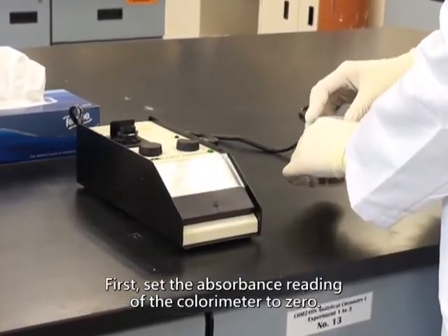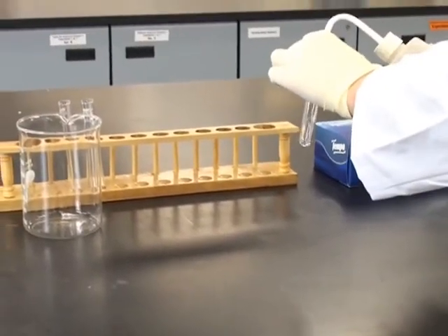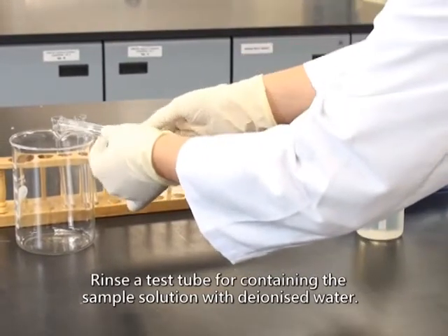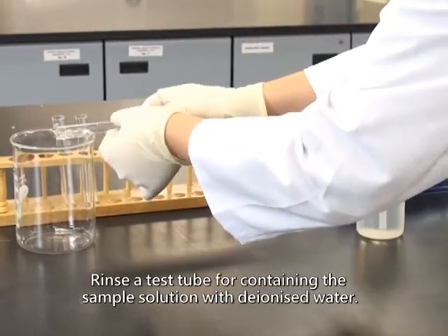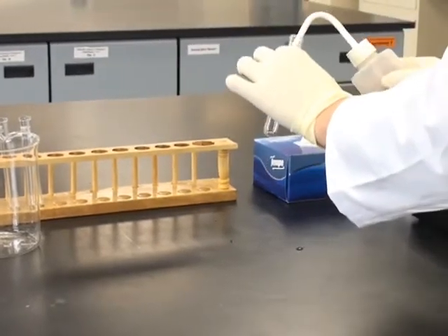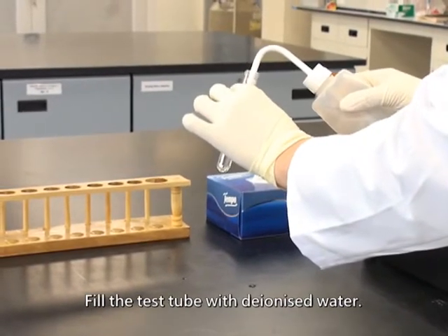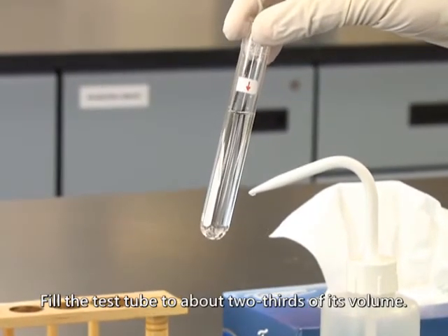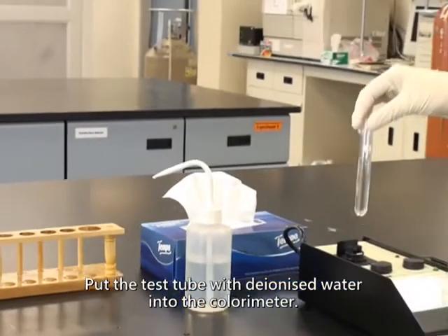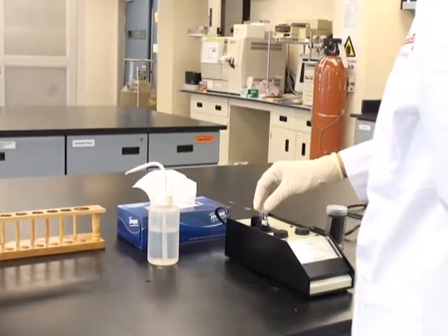First, set the absorbance reading of the colorimeter to 0. Rinse the test tube for containing the sample solution with deionized water. Fill the test tube with deionized water. Fill the test tube to about 2/3 of its volume. Put the test tube with deionized water into the colorimeter.